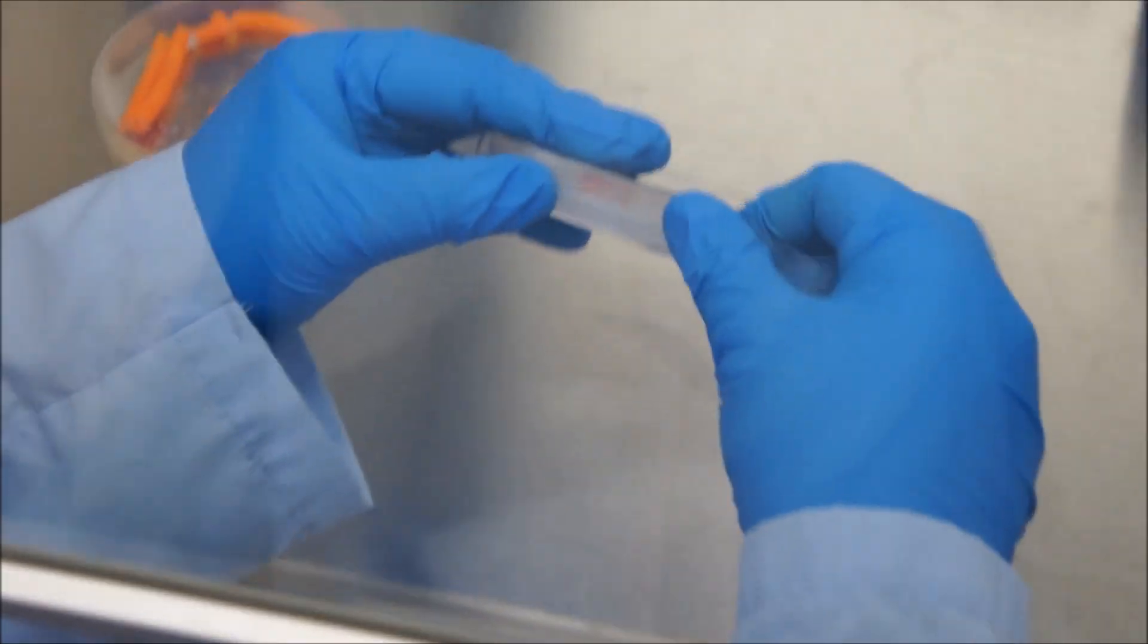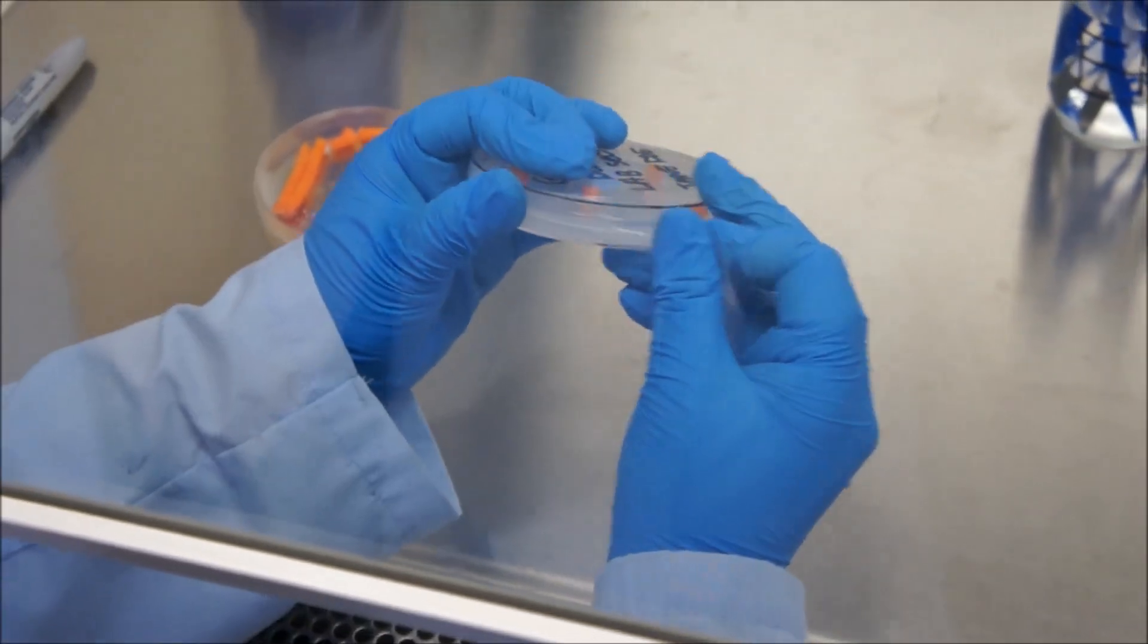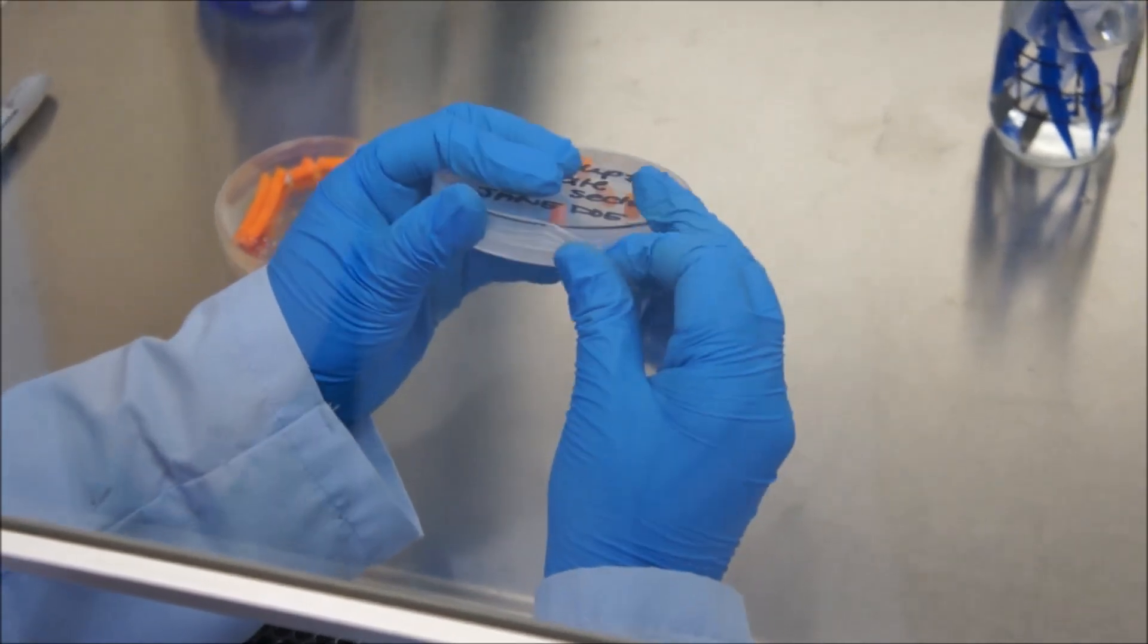Seal the dish with parafilm or put in a clear plastic bag tightly around the dishes. Repeat this procedure until all students have finished.